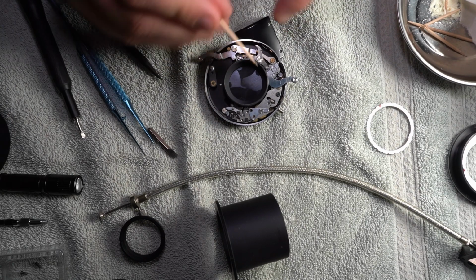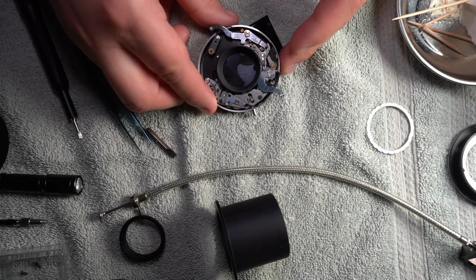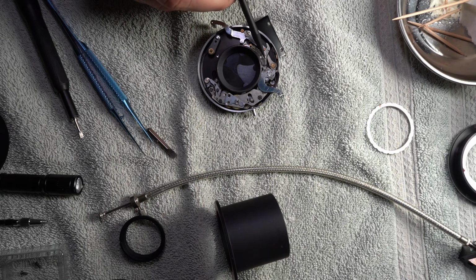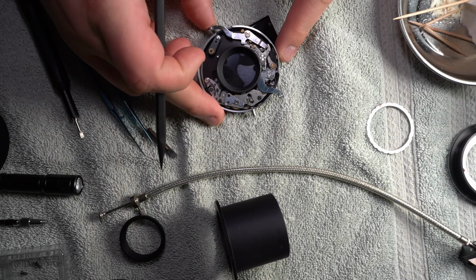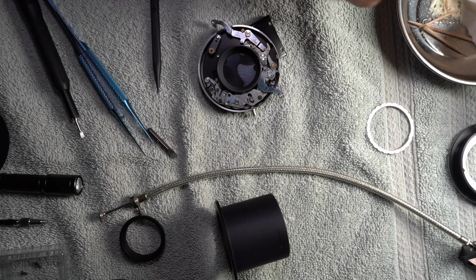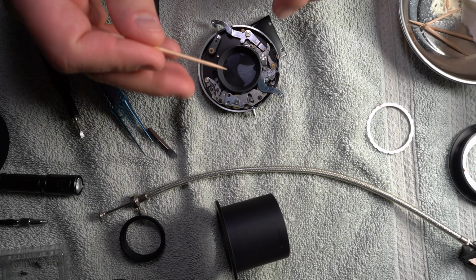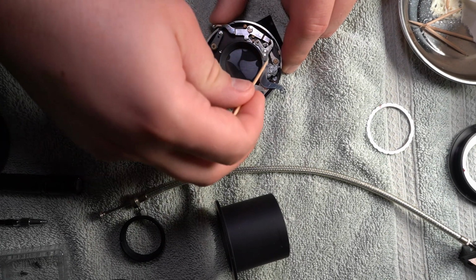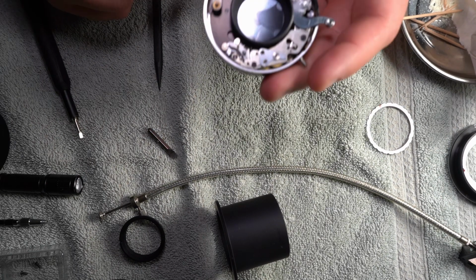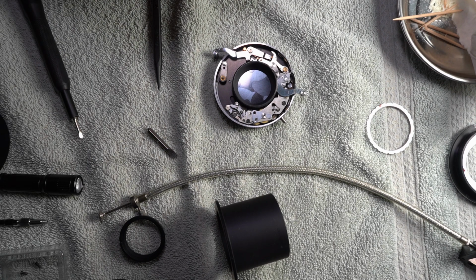On the end of this bar. So I don't know if you're gonna be able to see that again or not, but right here, watch this. There's another bar underneath that, and I'm gonna try and grease the end of that. Or actually not the end of it, but the part where this other one moves across it. And the end of it. There is a point on watch movements, I know from wrist watch revival. Man, I'm never going to be able to say that thing right.